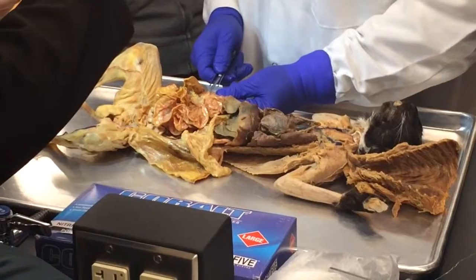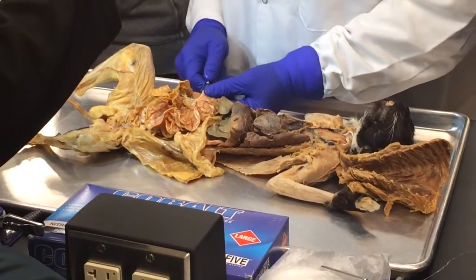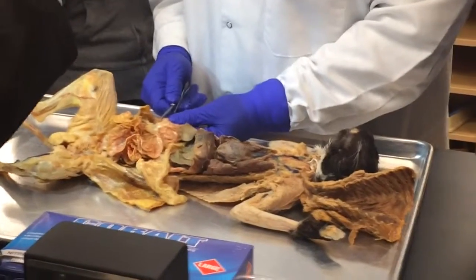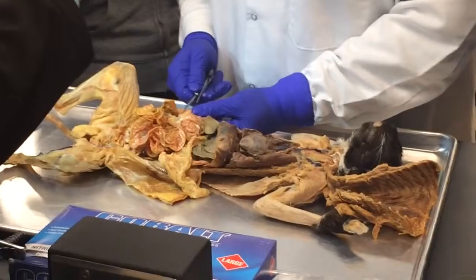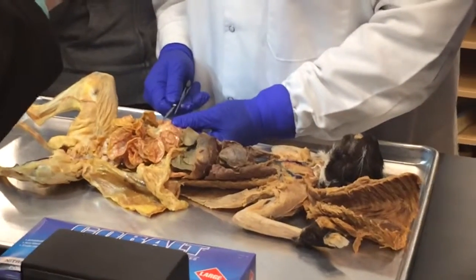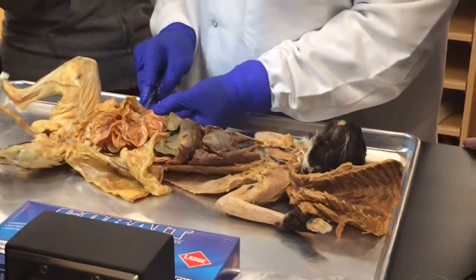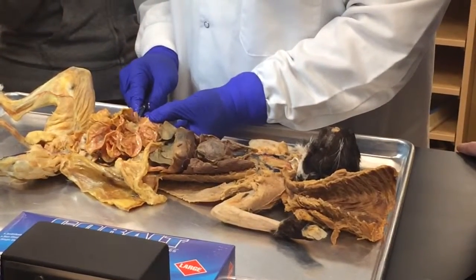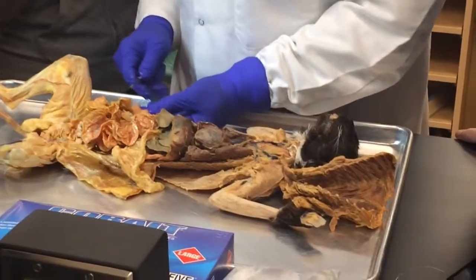Again, the ceca is right at the junction. And I guess the ceca is really supplying some of the microbes in the small intestine here that are making all those B complex vitamins and vitamin K that are only absorbed in this area, in this ileocecal junction, right there. They're only absorbed right here in this little part, after all the 6 meters.